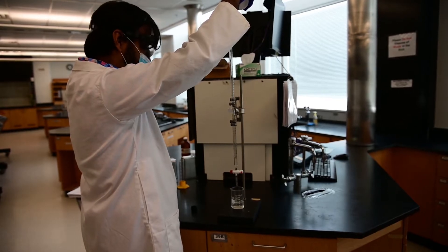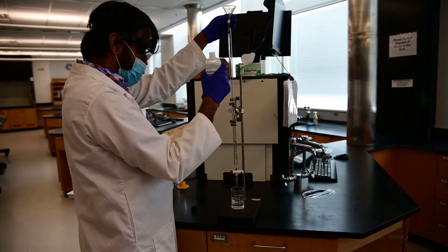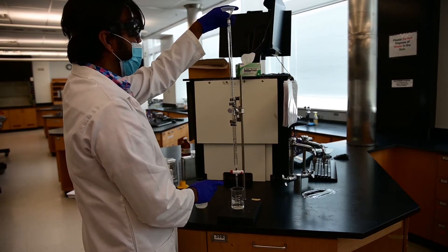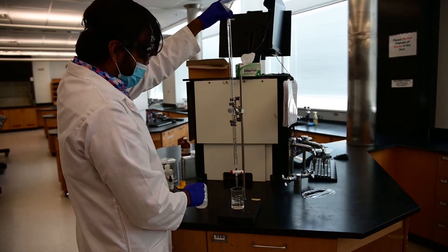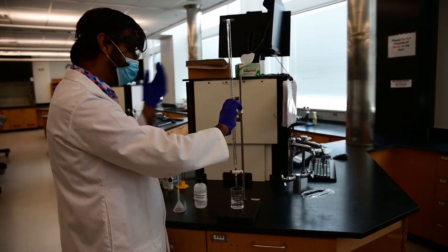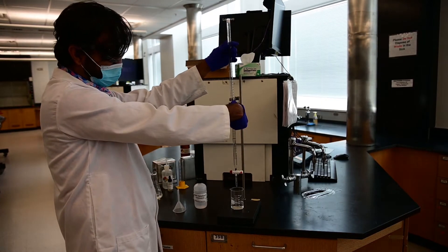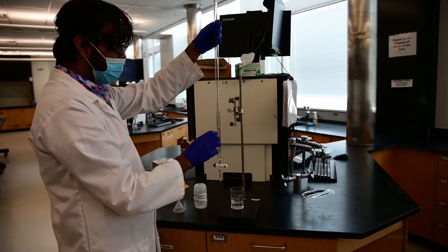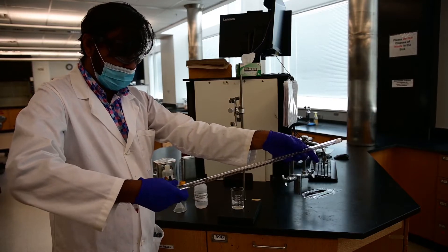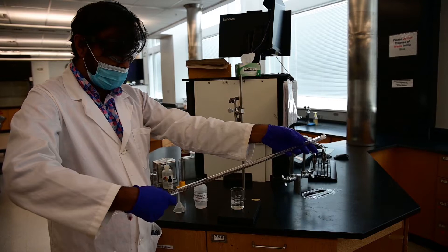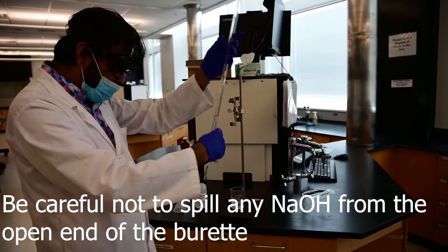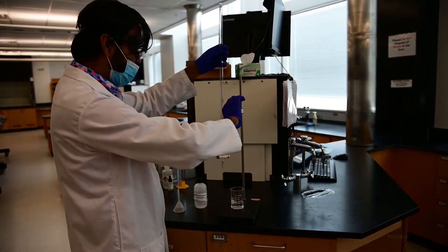You don't want to fill it up at this stage because you have to rinse the burette with your sodium hydroxide. So now for rinsing, I filled out one third of the burette. Now this clamp that I have the burette attached to, if you push these front tabs, it will release the burette. And then I would just roll the burette like this so that the liquid solution, sodium hydroxide, completely covers the glass wall of the burette.